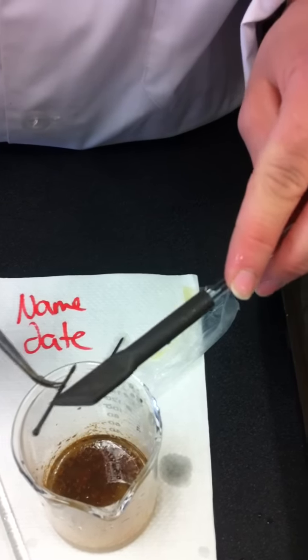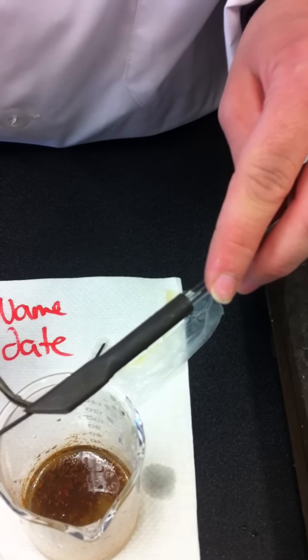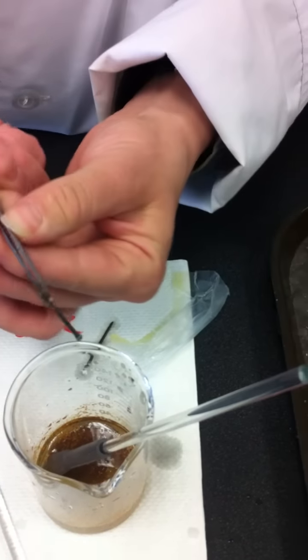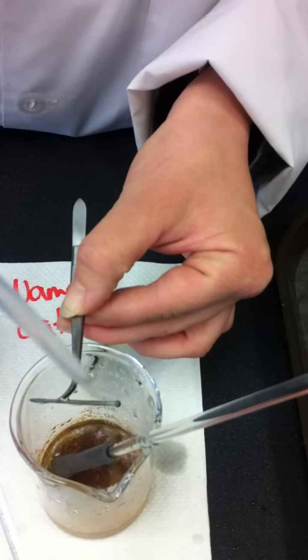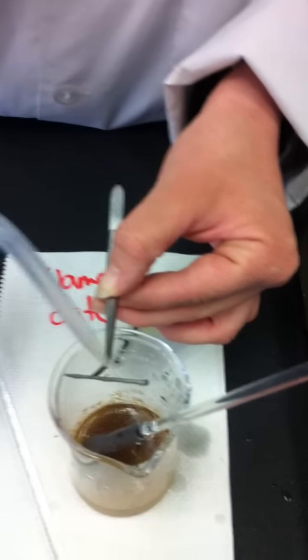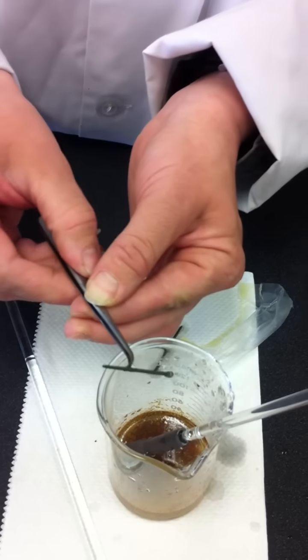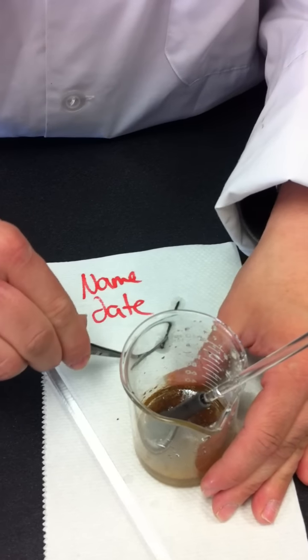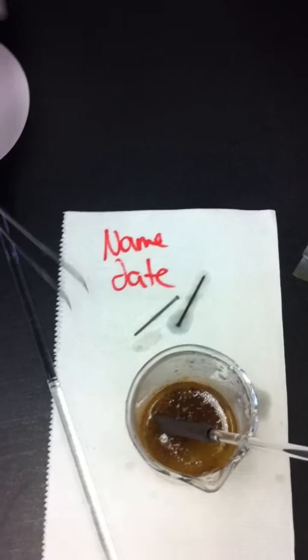So I can see a little bit of copper. So I'm just going to rub it off with my rubber policeman. I'm going to stick that in there so I don't lose any of the precipitate. This is a quantitative thing, so you want to be careful to collect all your precipitate. All right, so there's the two nails. So we'll set those to dry until tomorrow, where we'll take their mass and see if they've lost some mass.